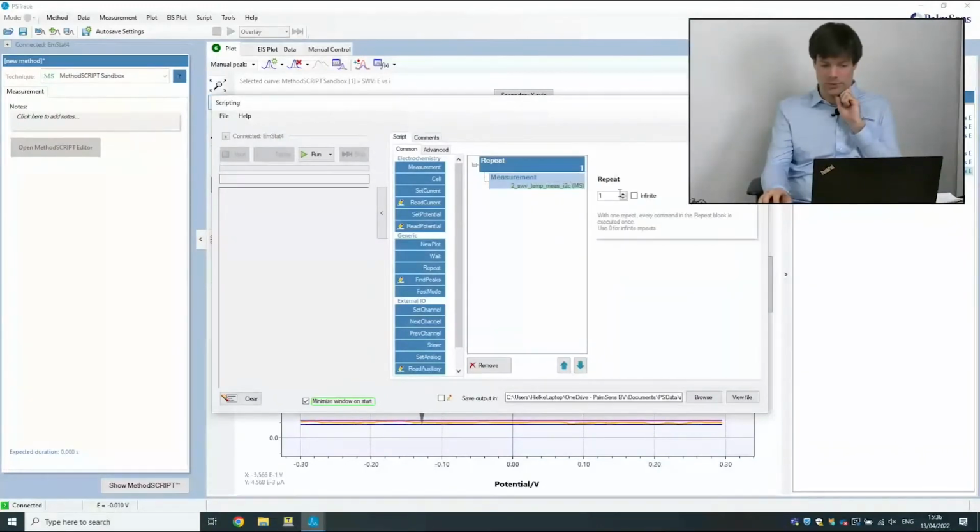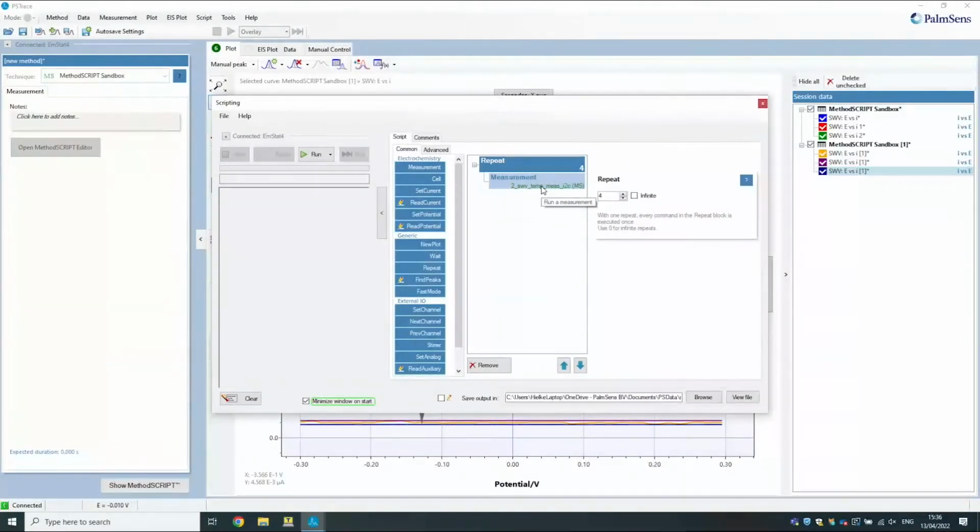And now I have it in a repeat loop where I can do it many times after each other. So you could make a MethodSCRIPT piece, save it as a method file, and then load it into this measurement block to have this hybrid of our scripting window and MethodSCRIPT.